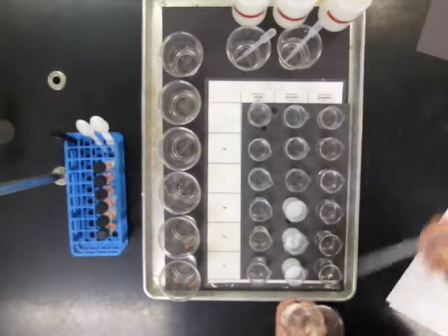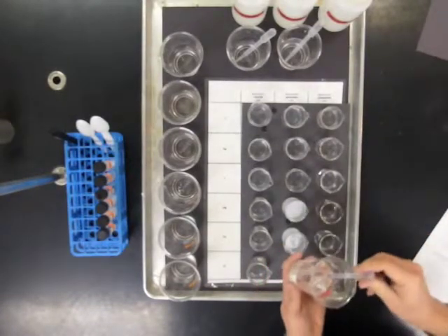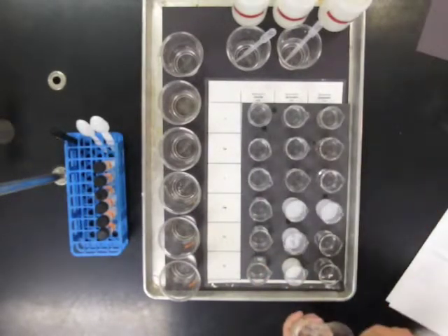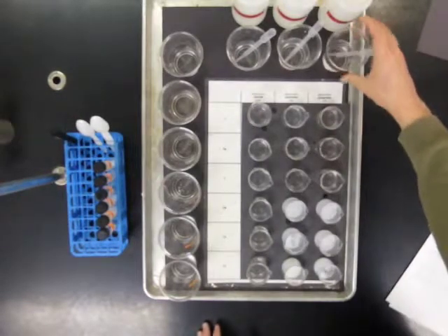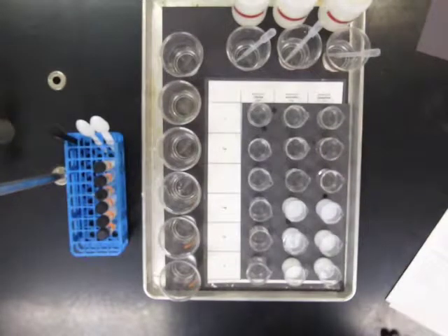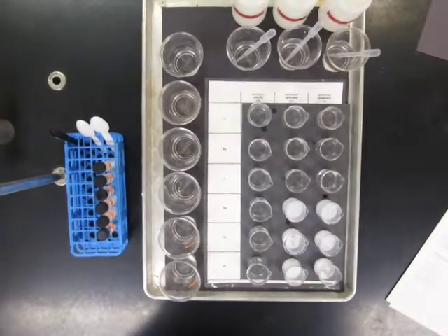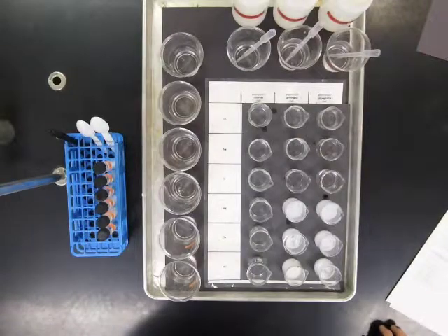Likewise with phosphate, putting the phosphate ions into solutions here. Okay, magnesium, calcium, and strontium again have reactions with the phosphate, but the lithium, sodium, and potassium did not. Something in these 6 compounds is reacting or not with the 3 negatively charged ions that we tested.